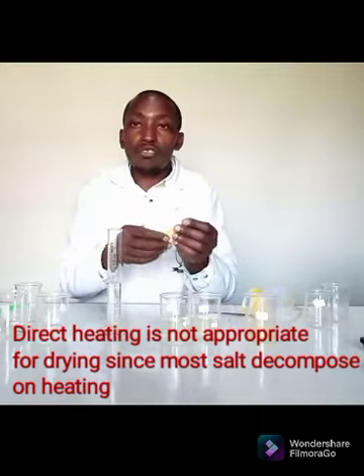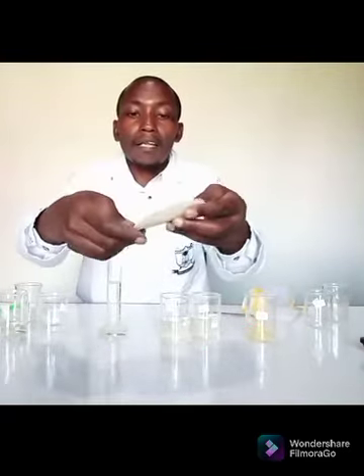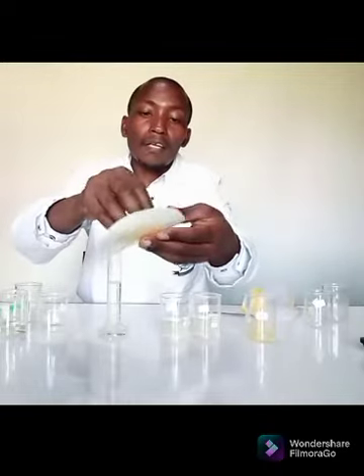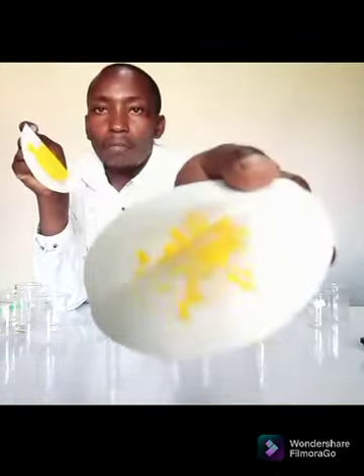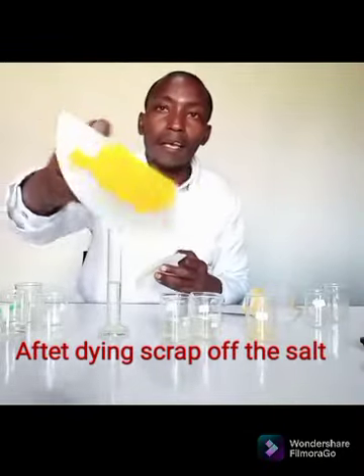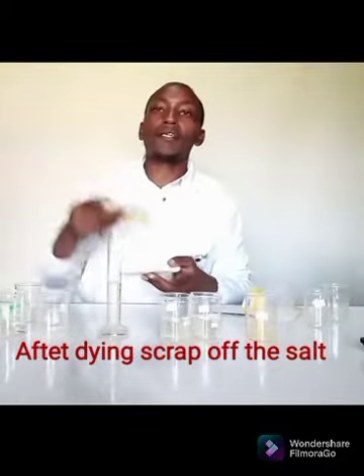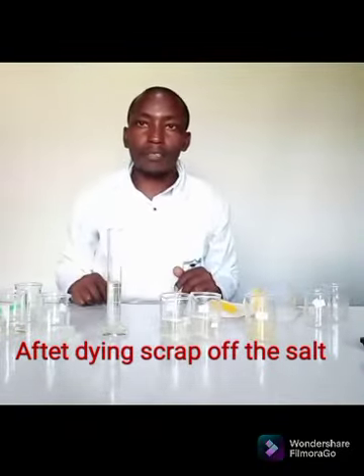So I can even use two filter papers, and then I can show you the solid. Maybe I'm not intending to prepare too much of it. So the solid is there. And I remember I've said I can as well do the sun drying, or dry it using an oven, etc.